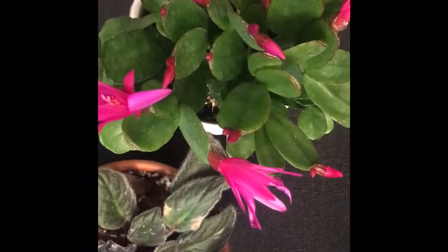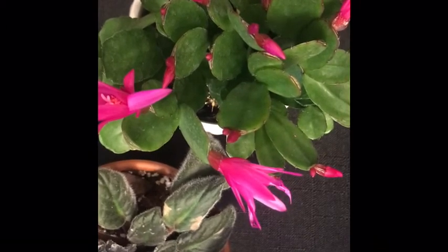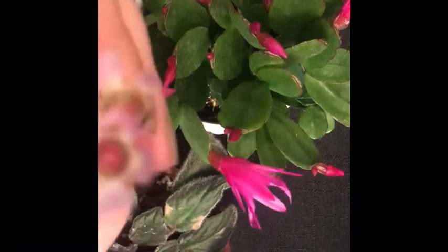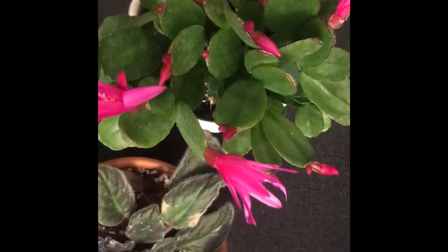So that was the dissection of the Alstroemeria, but I rummaged around Miss Marina's and my house and found some other plants that had flowers. And I wanted to show you because not all structures are the same as that Alstroemeria. So if you look here, I bought this plant at Trader Joe's too.